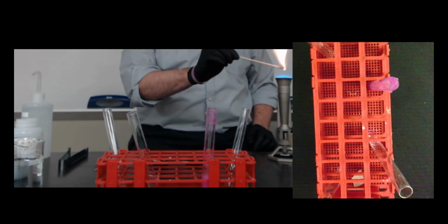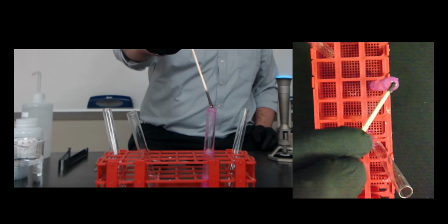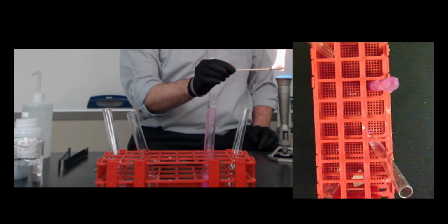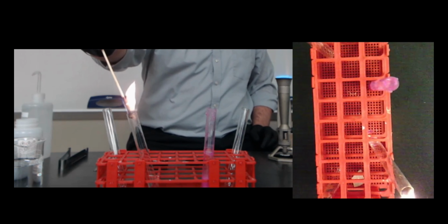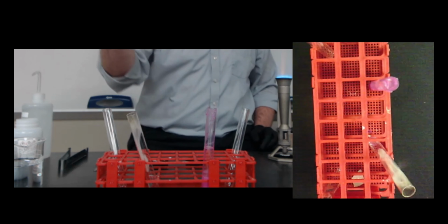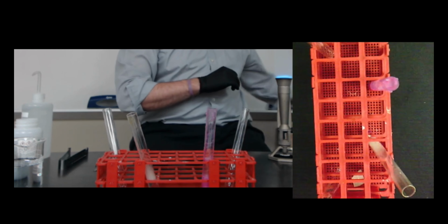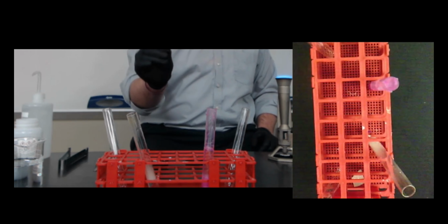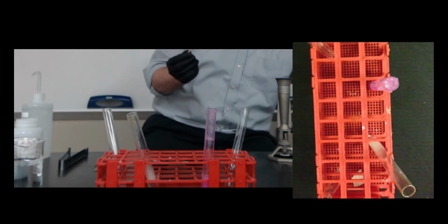I'm going to light my stick and see if we can get a good reaction here. Oh, I don't know if you heard that. We probably aren't going to get one from the magnesium. I have never been able to get a good pop out of the magnesium when just using water. See, and we can get a little more there. That popping sound tells us that it's hydrogen that we're making.